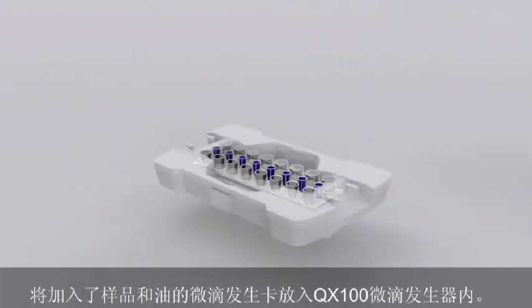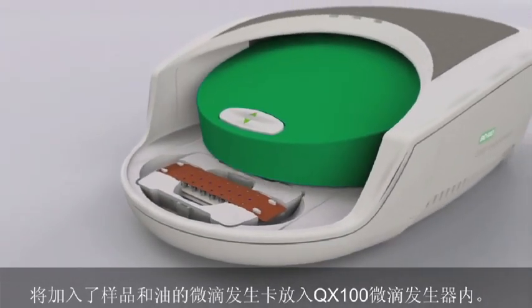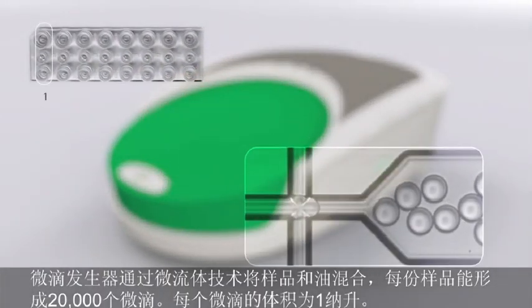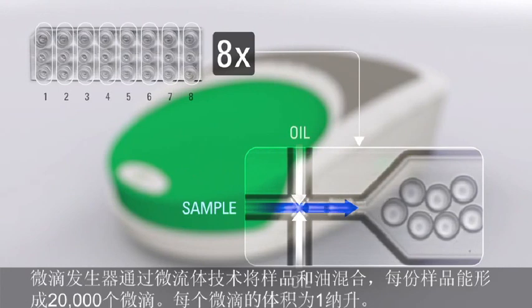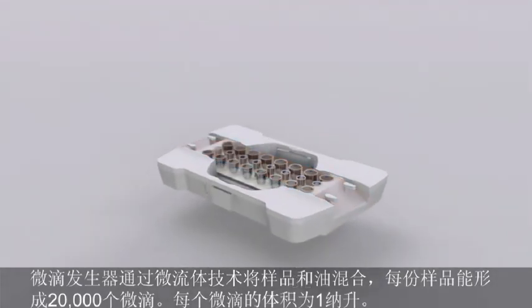Once the cartridge is loaded with prepared samples and oil, it is placed in the QX100 droplet generator. Using microfluidic technology, the droplet generator combines the samples and oil to create an emulsion of approximately 20,000 mono-sized droplets for each sample. Every droplet contains a nanoliter volume of the sample, including any target sequences that may be present.